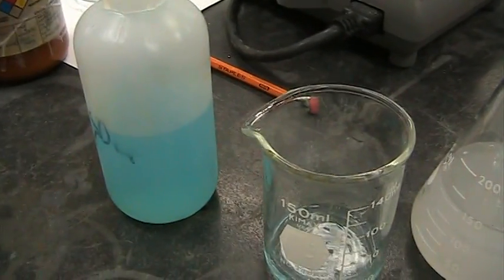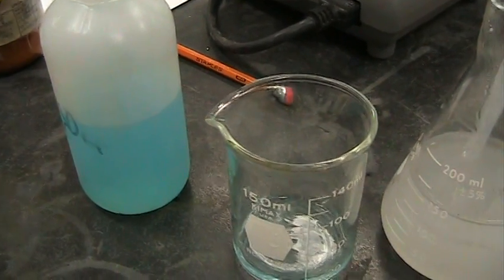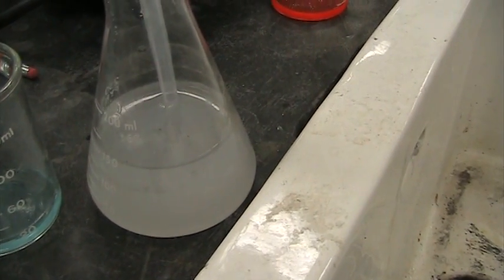So we're reacting copper sulfate, a clear blue liquid solution, with this kind of cloudy barium chloride solution.